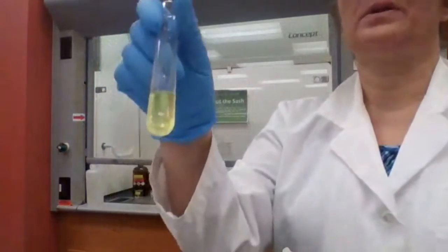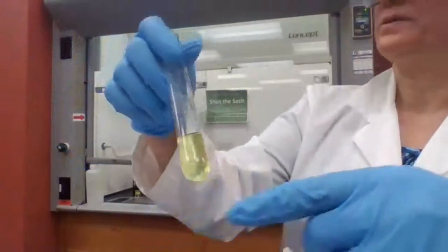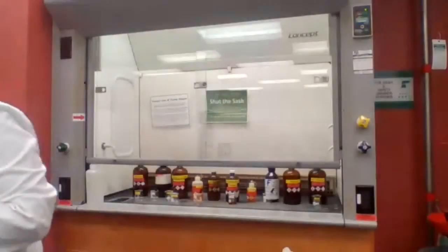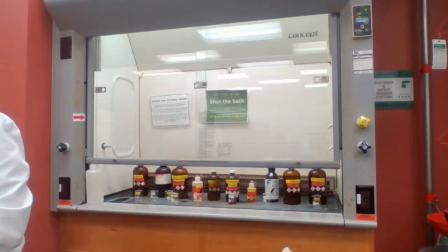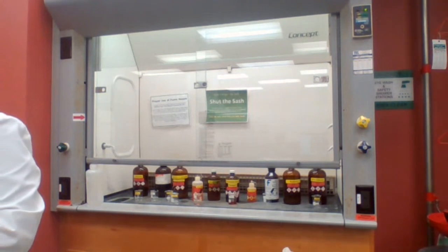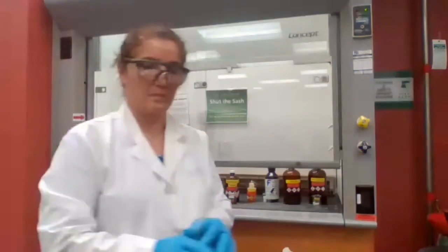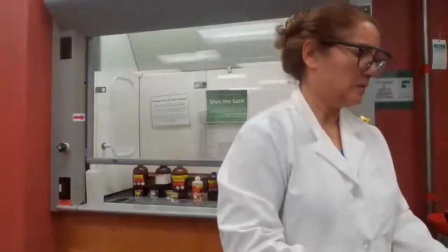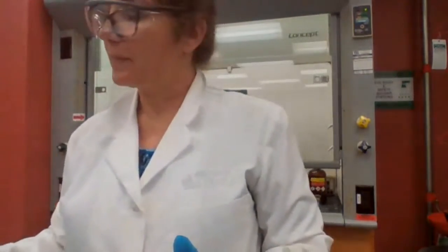Soluble in sodium hydroxide, but not soluble in sodium bicarbonate. Next, what's the next reaction or test?